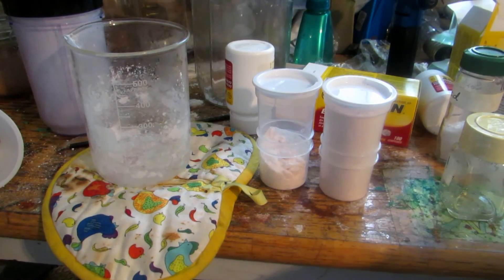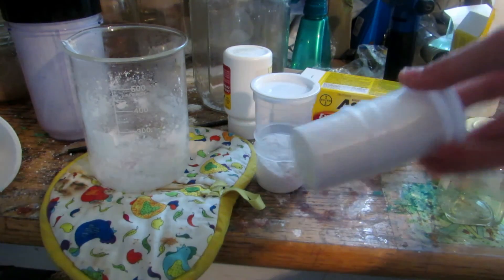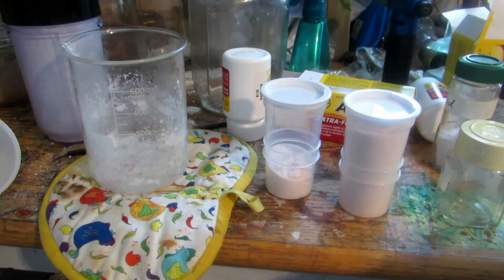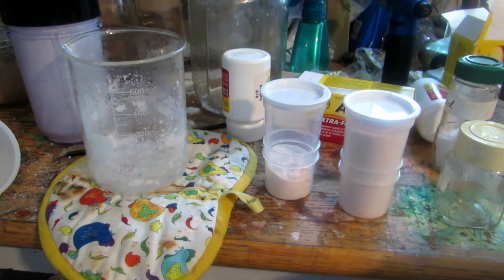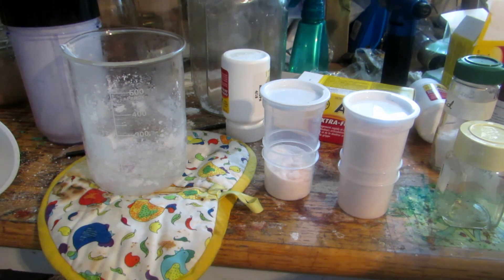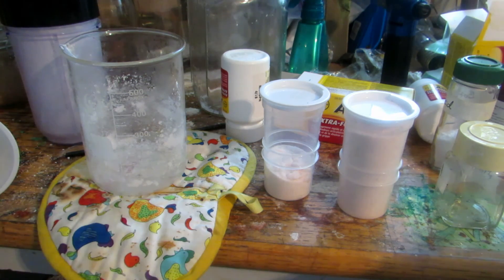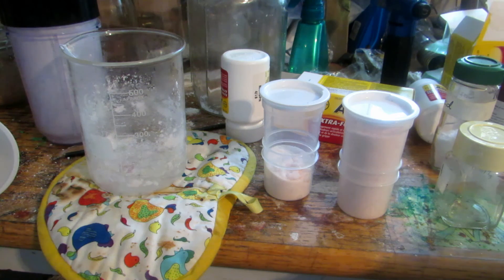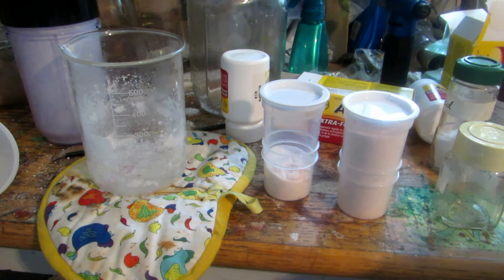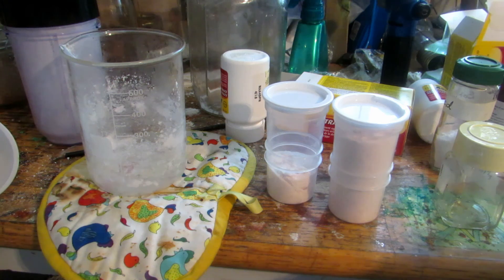After being thoroughly dried in the oven below its boiling and melting points, it was transferred to two jars in a nice fine powdery state. There's exactly 65 grams in one jar and exactly 20 grams in the other, so together we got about 85 grams of acetylsalicylic acid. We should have gotten about 100 grams, so this isn't too good a percent yield considering we weren't doing any chemical process at all. Most of the loss likely occurred during the dissolution step — either we didn't use enough methanol or didn't let it sit long enough to fully extract everything. Still, 85 grams is enough to work with for lots of different reactions.